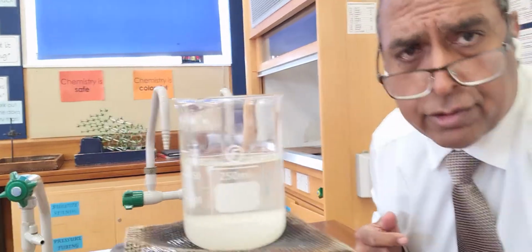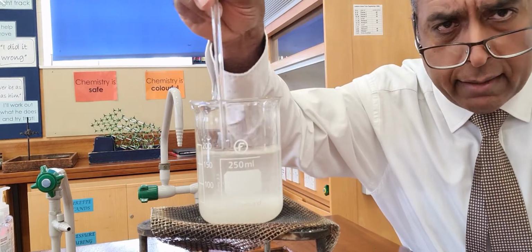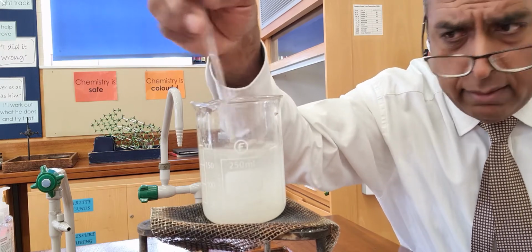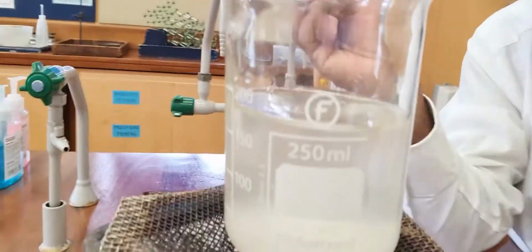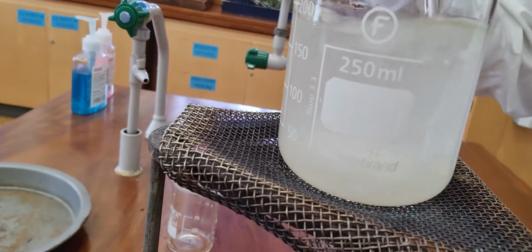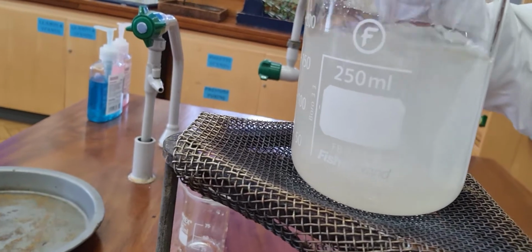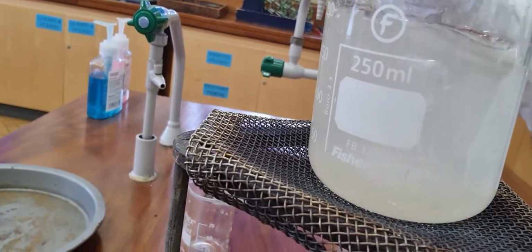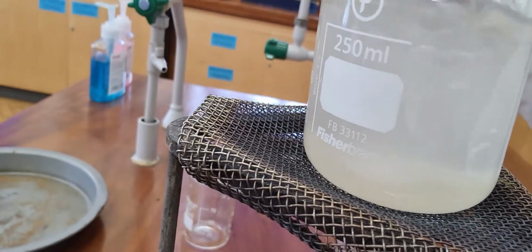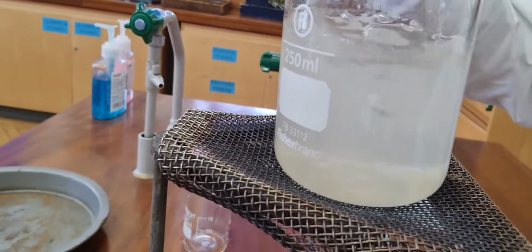That's 12 spoonfuls. You can see there's a whole load of sugar at the bottom there. If I stir it and get it moving around the beaker, then the beaker looks as though it's got little pieces of sugar floating around. They block the light and it's not all dissolved. I know when it's all dissolved, when I'll be able to see through it and there'll be nothing left at the bottom, which will take a bit of time.